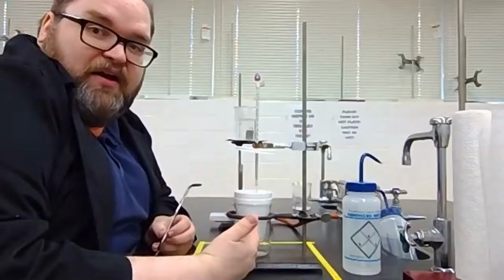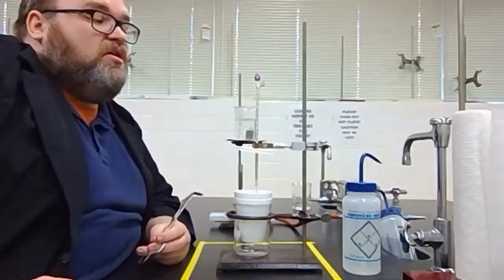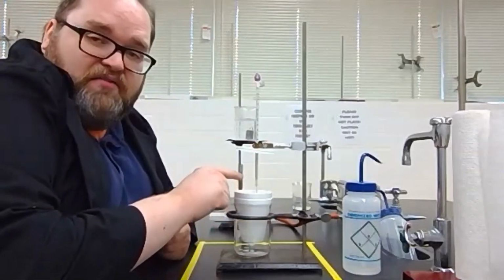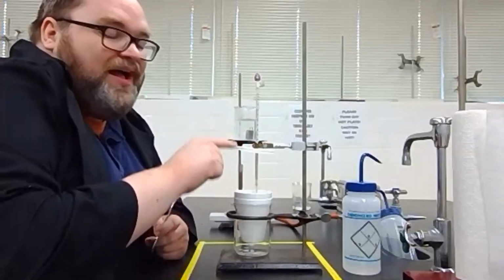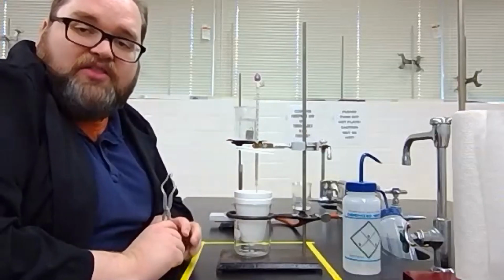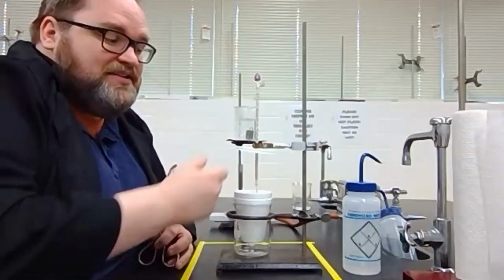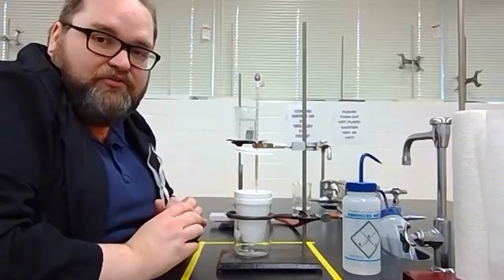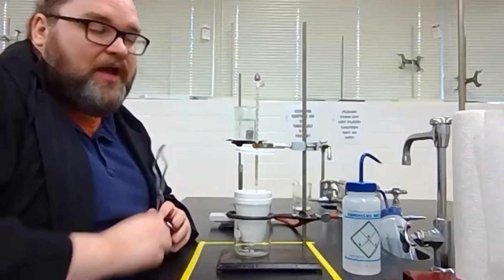We're then going to allow the water and the metal to come to the same temperature, that thermal equilibrium that we talked about. The way we're going to know that happens is that the temperature of the water is going to go up and go down a little bit. The temperature that the water reaches is the temperature at thermal equilibrium. That will start losing some to the air that's in the container, to the holes that are in the styrofoam. So we're going to take the highest temperature that we see for that.